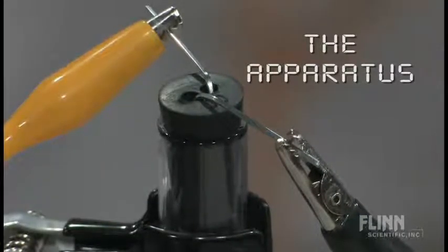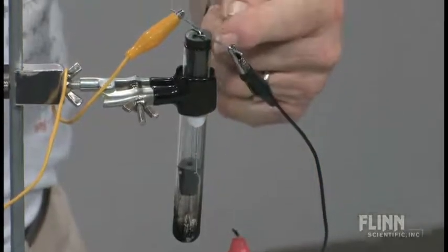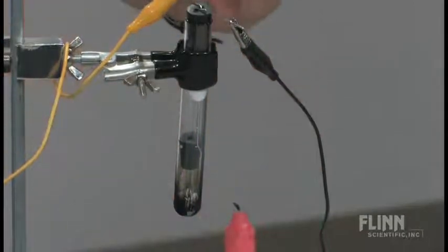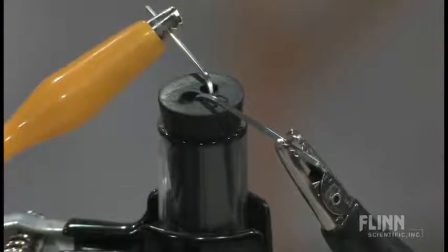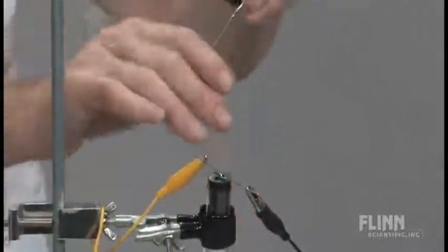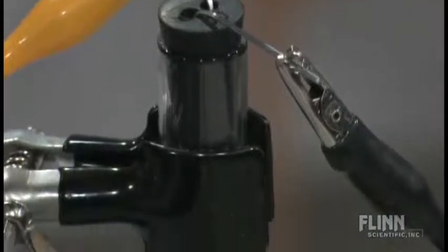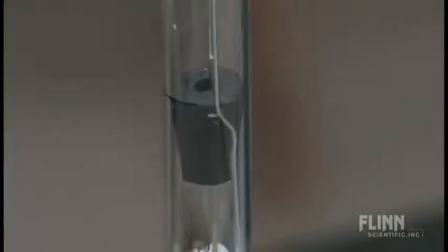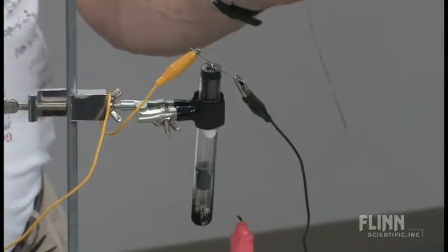In the test tube at this point, we have a one-hole rubber stopper, and at the other point in the test tube, we have a two-hole rubber stopper. The potassium hydroxide pellets were originally put in the test tube to a depth of just under a centimeter. The two leads connected to the yellow and black alligator clips are large paper clips that were opened up to form electrodes. One paper clip was inserted through the two-hole rubber stopper and around the outside of the one-hole rubber stopper. The second paper clip was inserted through the other hole in the rubber stopper and through the one-hole rubber stopper, and the stopper was lowered into the test tube to keep the two electrodes separated so they didn't create a short circuit.